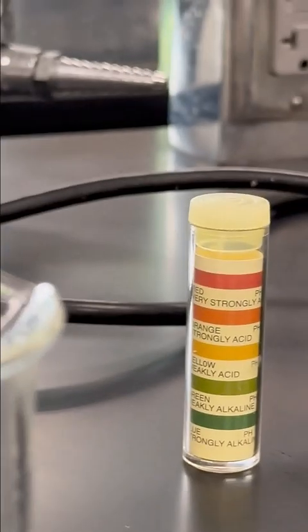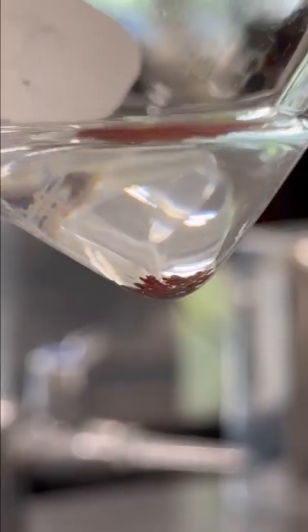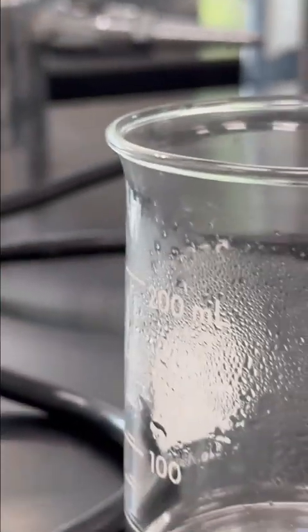So I'm going to pull out the stir bar again, and we're going to decant our solution off of there. Okay, so here we have our spongy red copper that we've made. It's down here. And I'm going to set up my camera so we can do the decanting again.